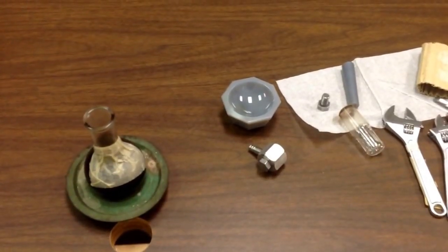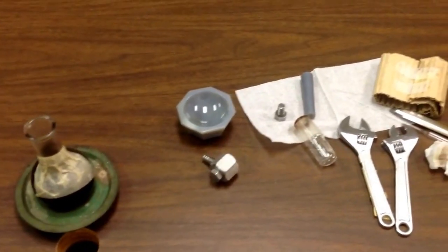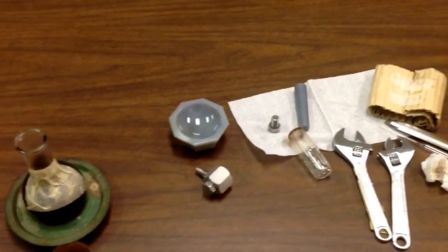Now, good morning. The next thing I want to do is show you how we're going to make a potassium bromide salt plate.